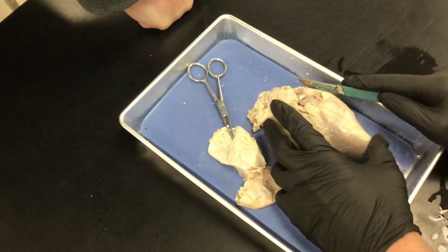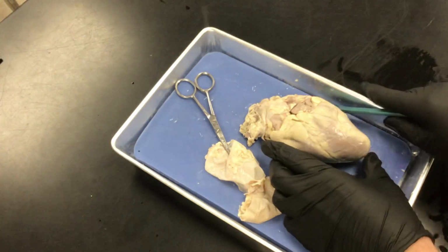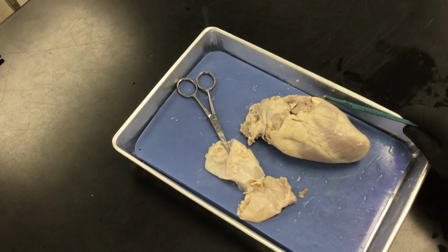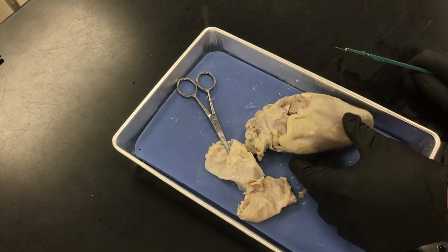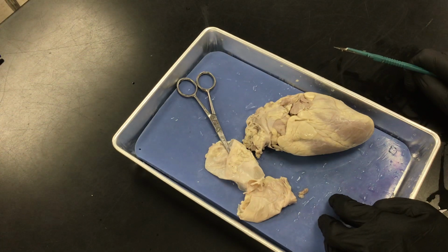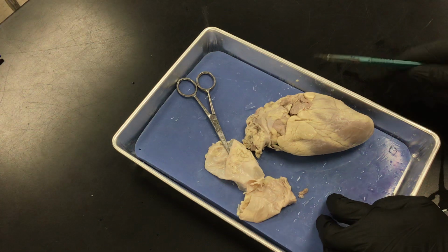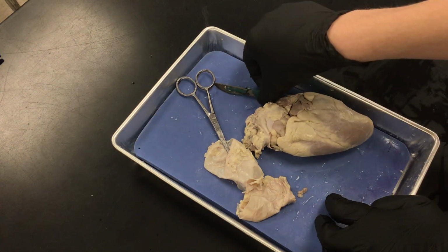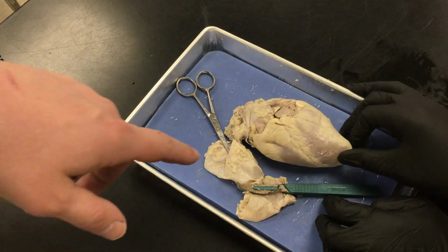Actually, no. Your coronary arteries take oxygenated blood to your heart because your heart is still a muscle. It still needs oxygen to function. So if you didn't get oxygen to one part of your heart, what could happen? Okay, so again, guys, if one of those arteries gets clogged, what happens? What's the biggest heart thing you always hear about people having? A heart attack, right? That's what happens. It's myocardial infarction. So that net on the outside of the heart is the coronary artery.